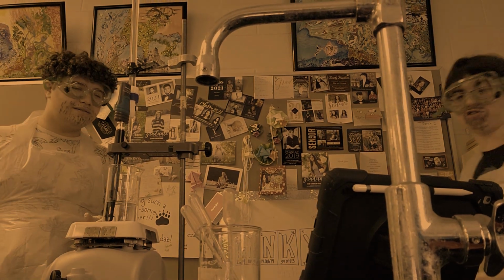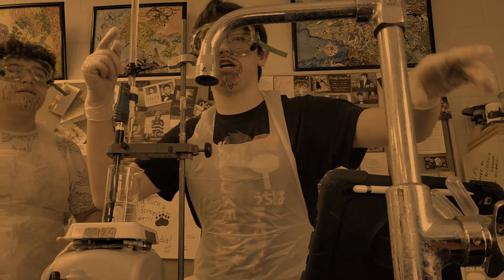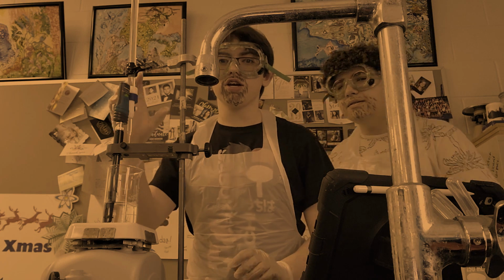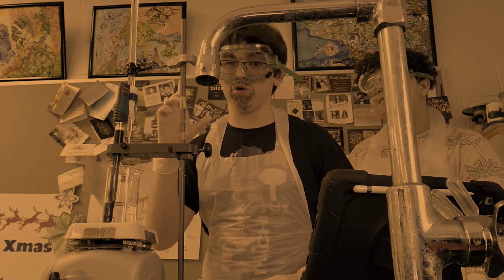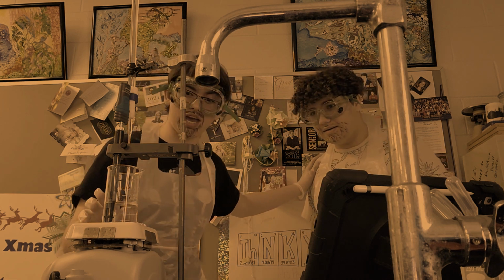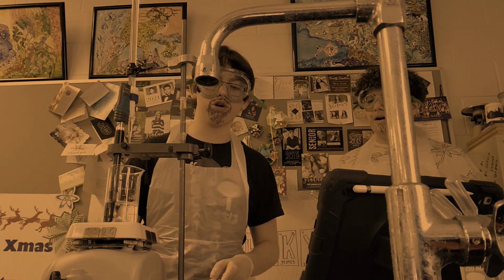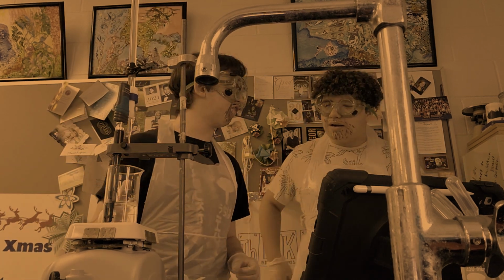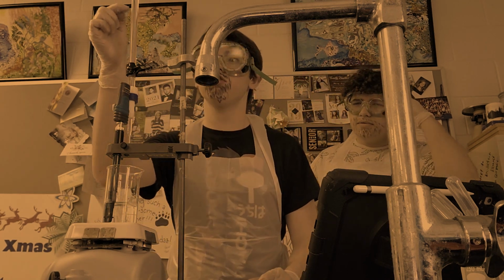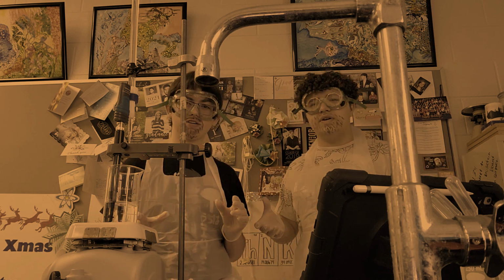So, Mr. White, what are we mixing? Well, I'm glad you asked, Jessie. First, we're going to be starting off with what we have in our burette. We have HNO3, specifically 0.75 molar. And then, in our beaker, we have ammonia, NH3, and it's going to be 0.25 molar. Conveniently, we have 75 milliliters, and hypothetically, we think that 25 milliliters of this HNO3 will get us to our equivalence point, Jessie. Well, why are we using such random chemicals, Mr. White?